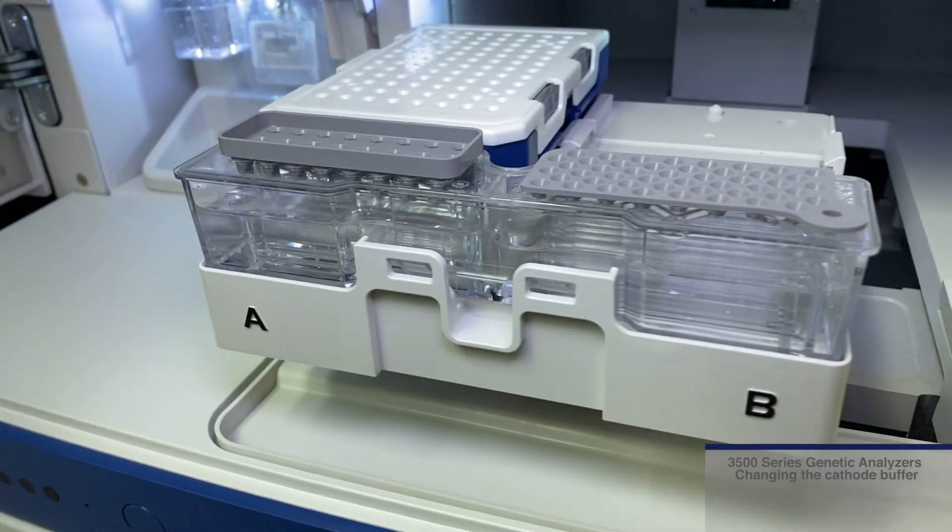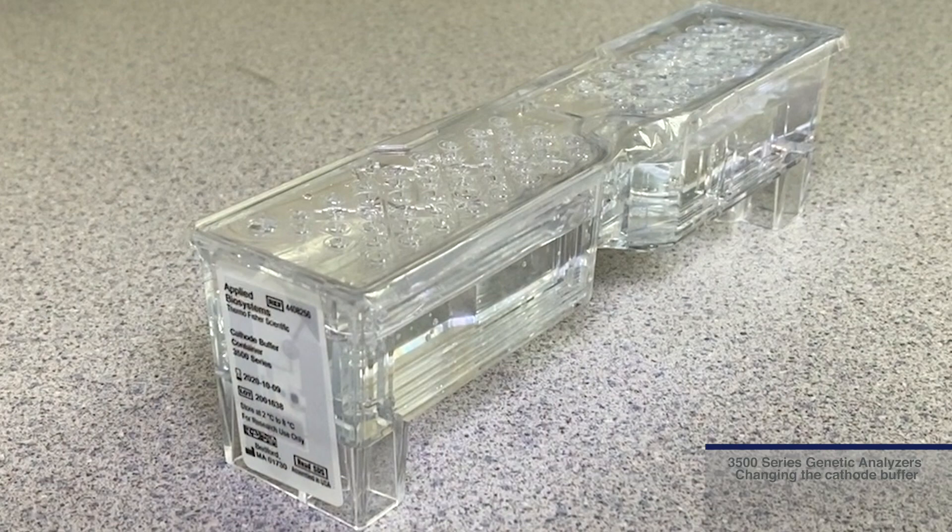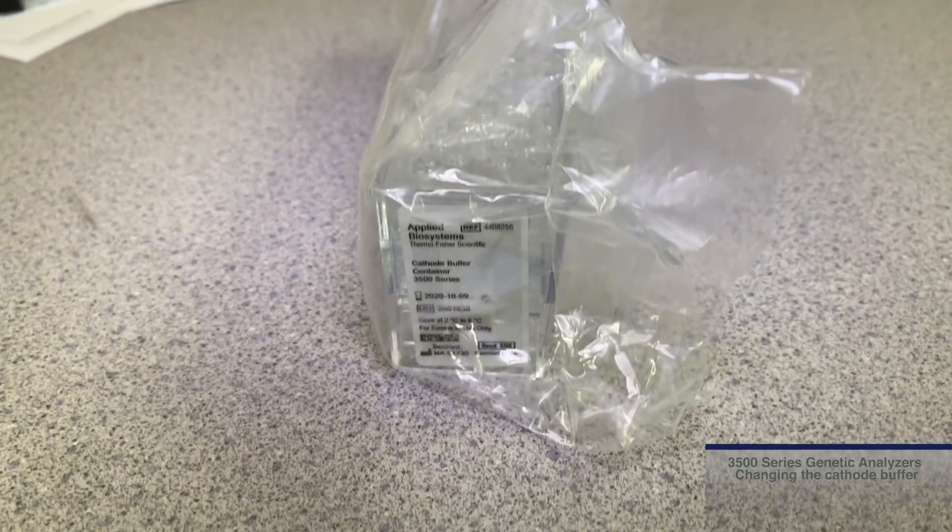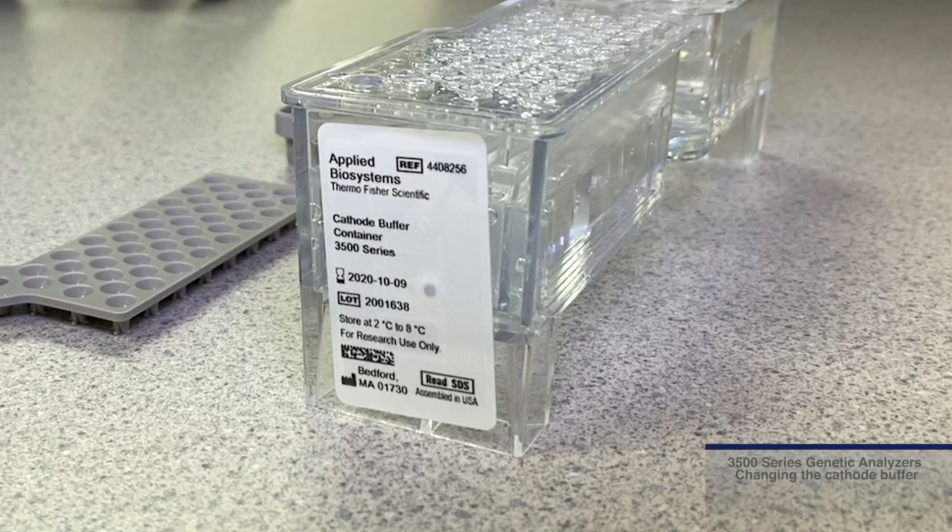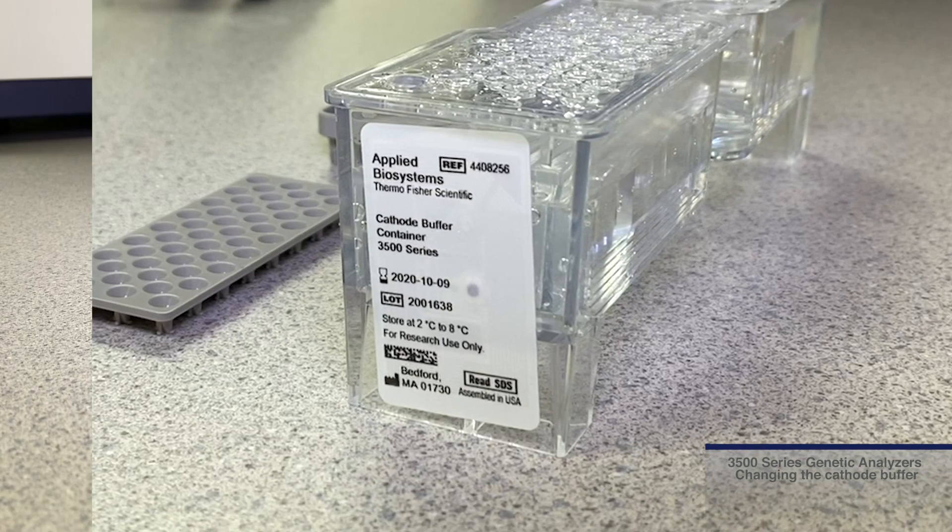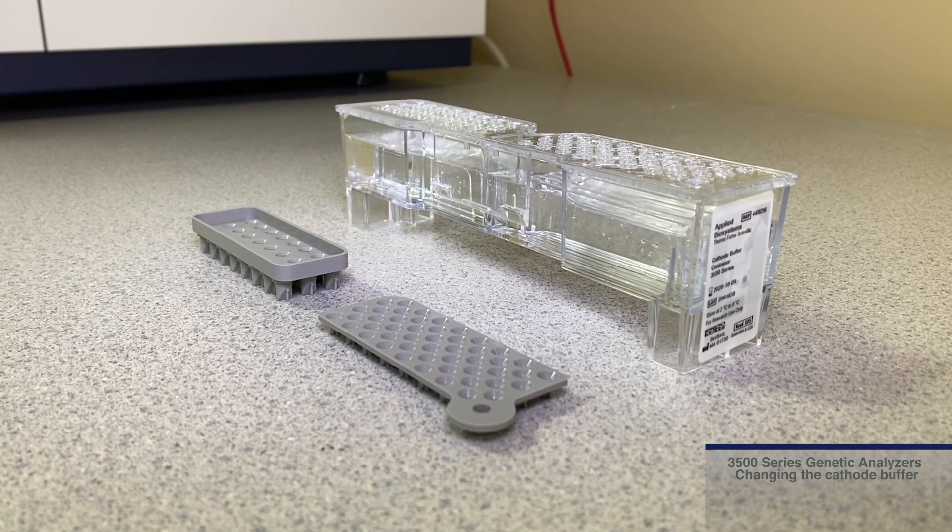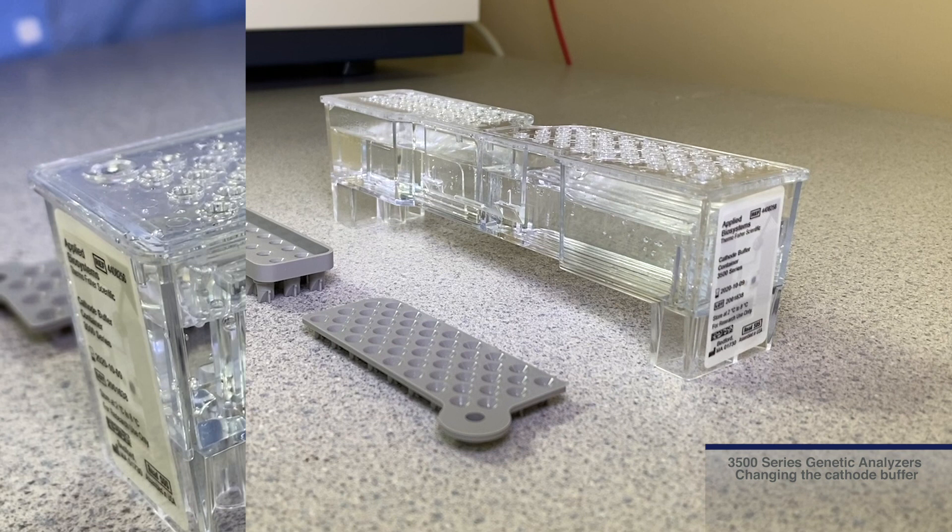The cathode buffer container or CBC contains a 1x running buffer that supports electrophoresis on the 3500. The CBC has been verified for use up to 14 days on the instrument or 240 injections on an 8 capillary instrument or 100 injections for a 24 capillary instrument, whichever comes first.